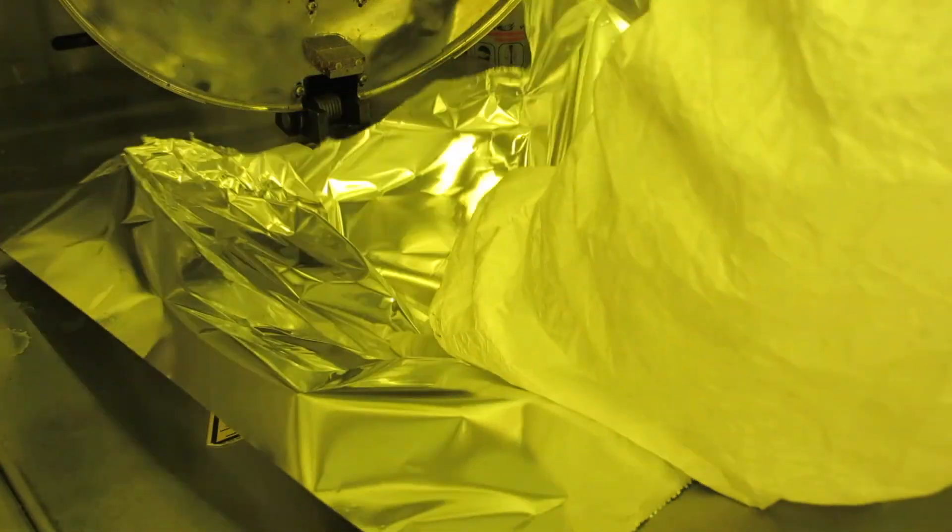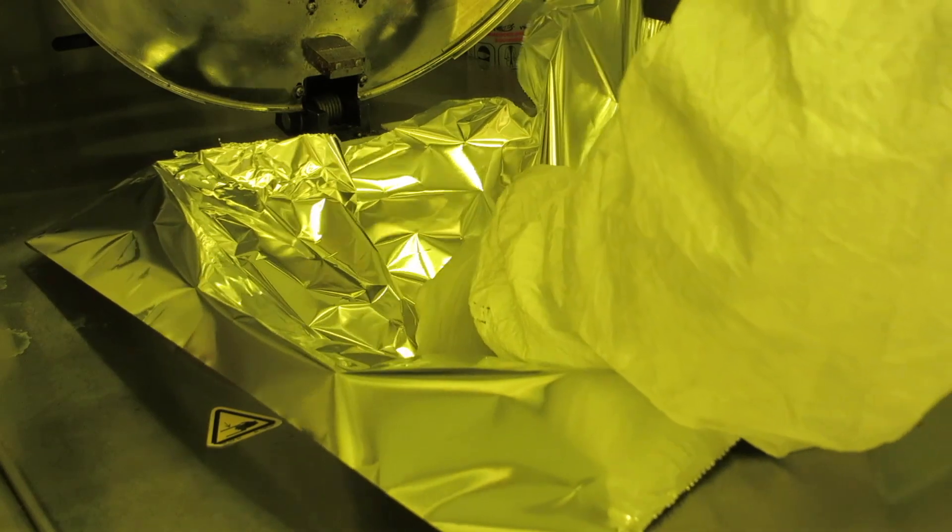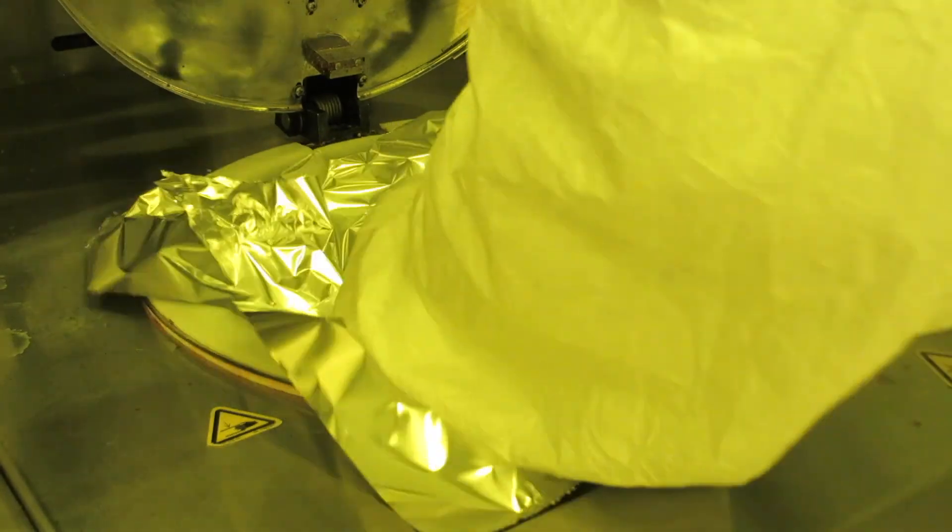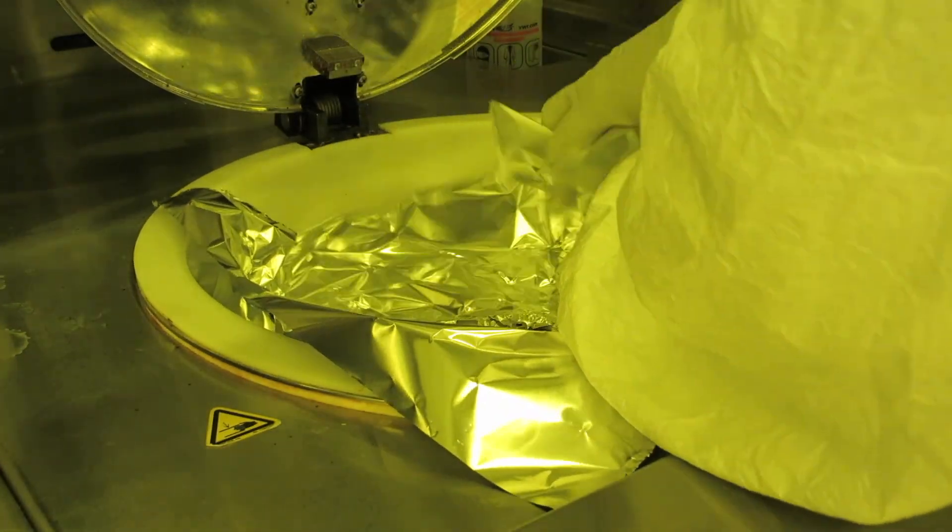The idea is to cover up as much of the bowl as possible on the inside. It'll make cleanup a whole lot easier. Poke a hole in the center of the foil so that the shaft can come through, and then tuck in the rest of the foil so that it's all within the bowl so that you'll still be able to close the lid of the spinner.